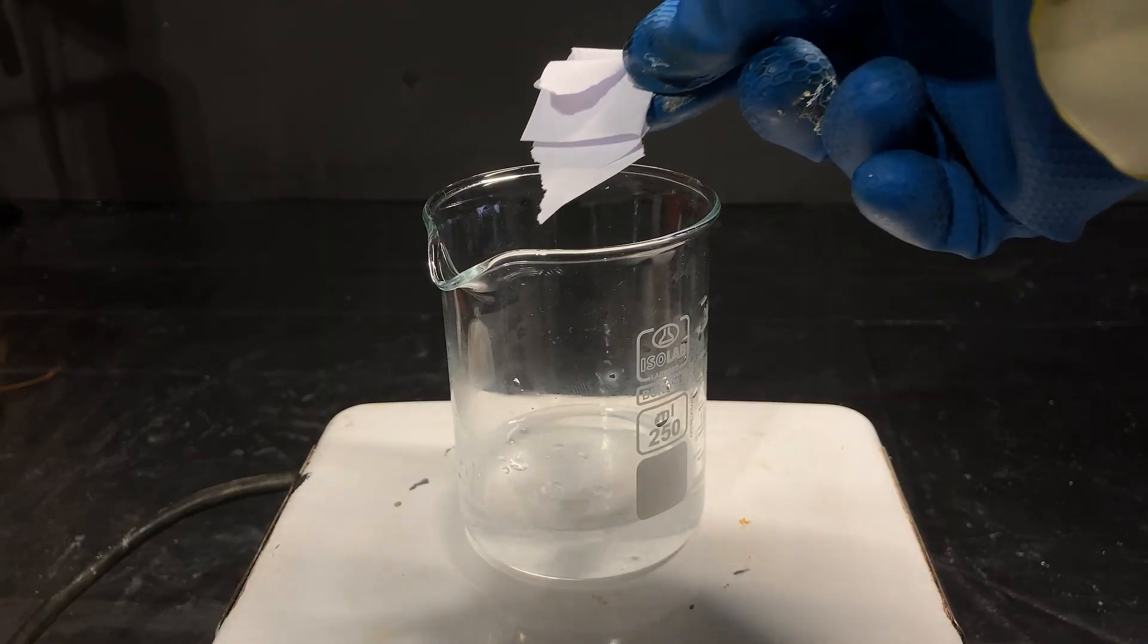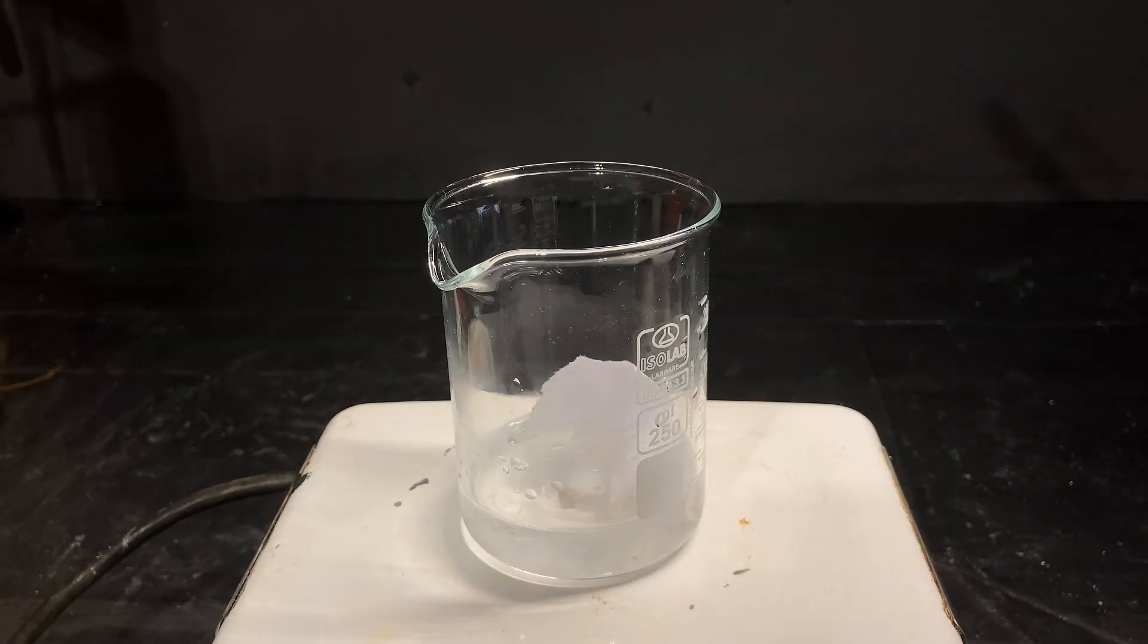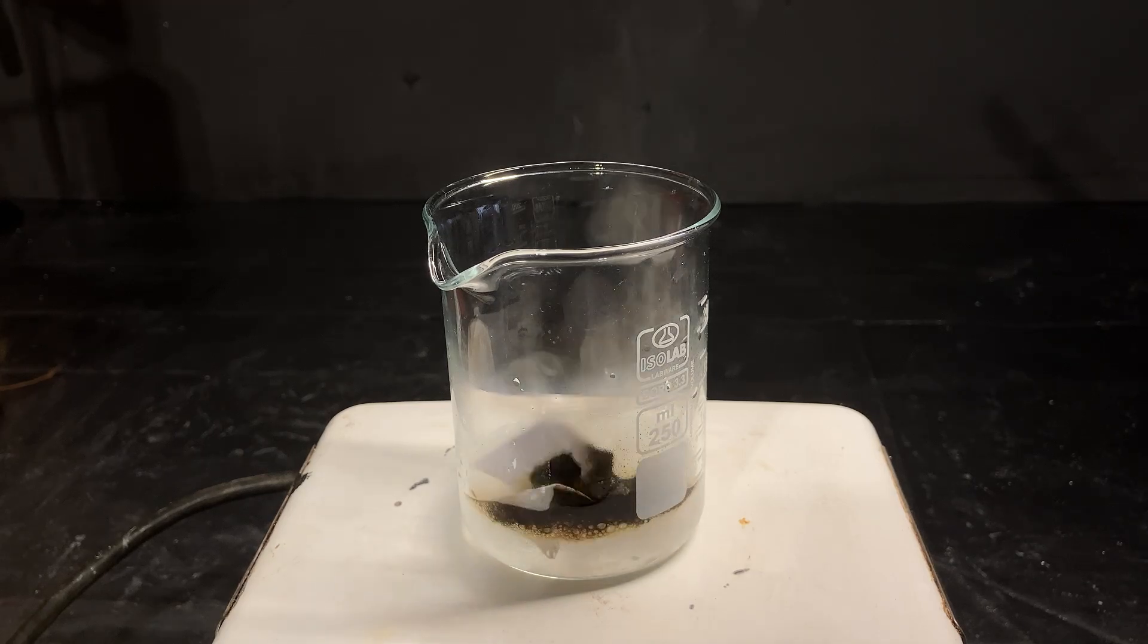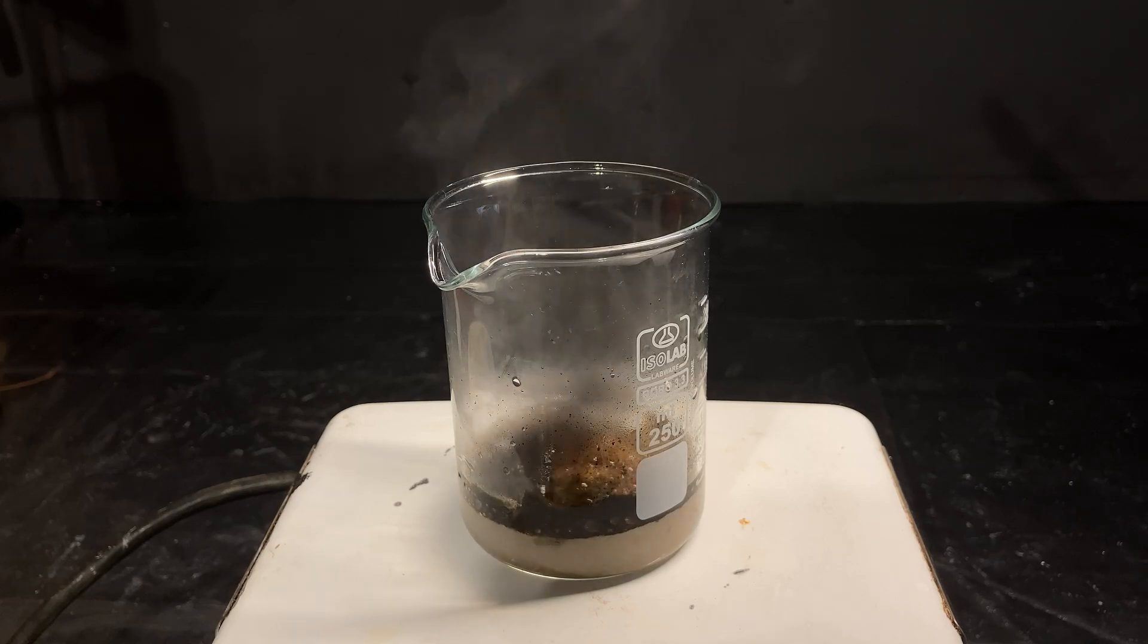Now, I can start throwing some organic stuff into it. This is the fun part, so I tried some paper first. Immediately, it gets obliterated and vaporized into CO2 gas.